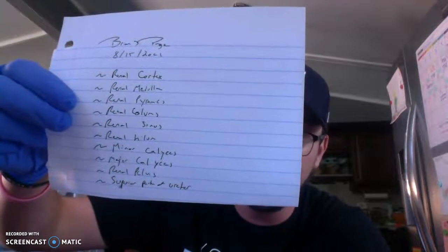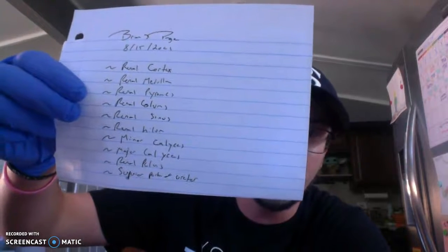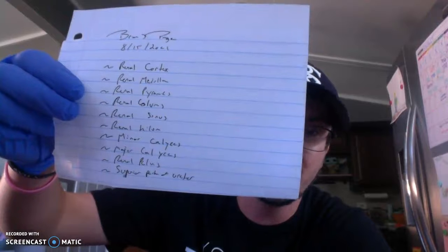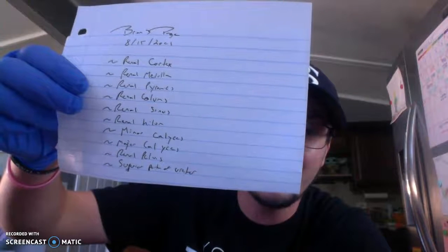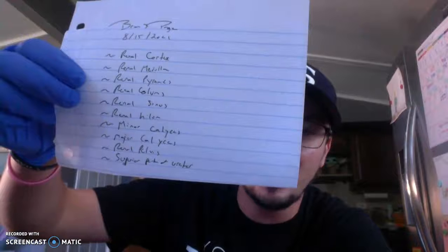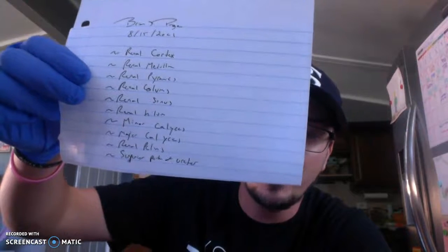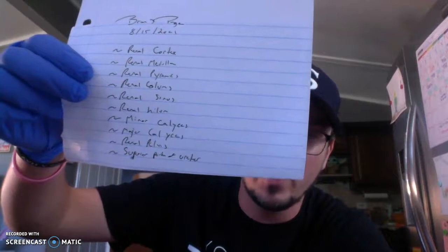We'll talk a little bit about the elements of the kidney. We'll talk about the cortex, the medulla, the renal pyramids, the columns, the renal sinus, the hilum, the calyx — to include both the minor and the major calyxes — the renal pelvis, and the superior portion of the ureter.